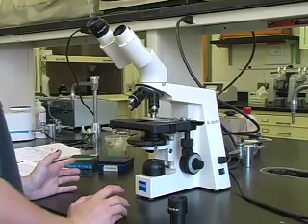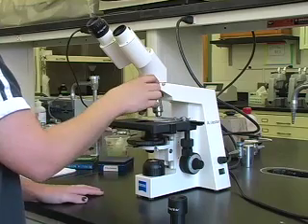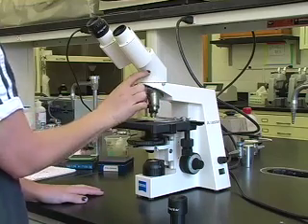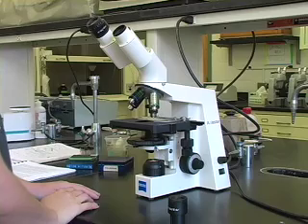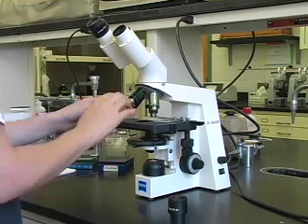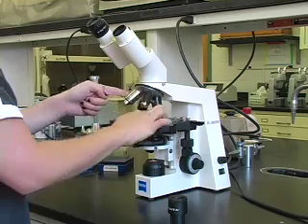When you change objectives, you must refocus on the specimen, refocus the condenser on the lamp iris, and adjust the diameter of the lamp iris to keep the microscope in Köhler illumination.